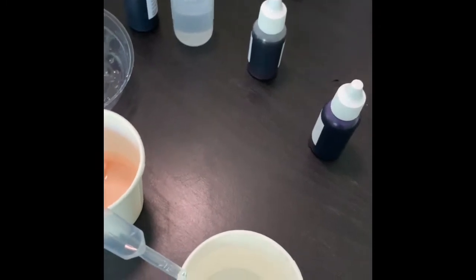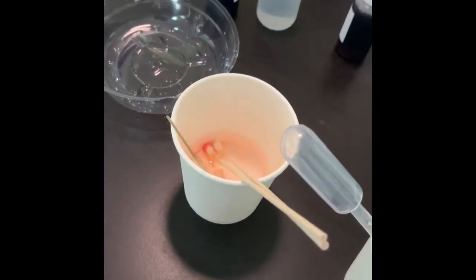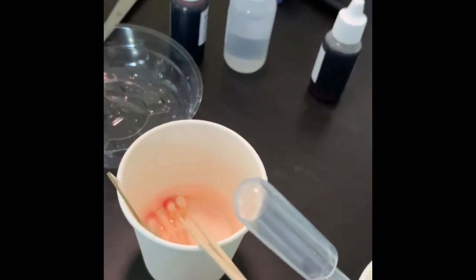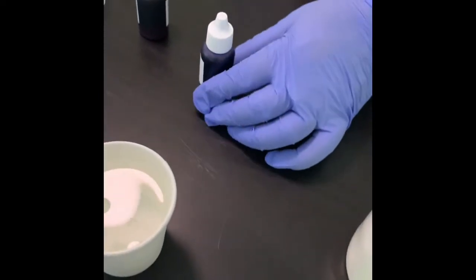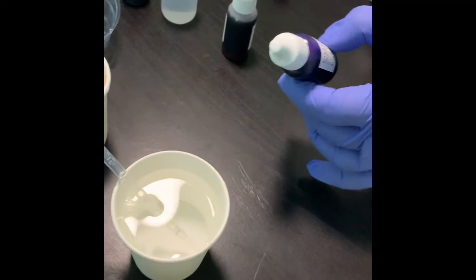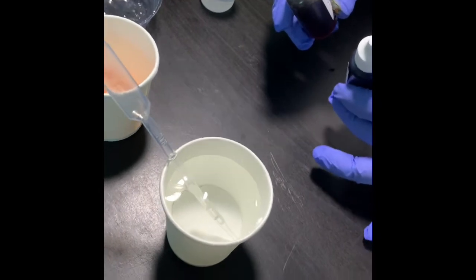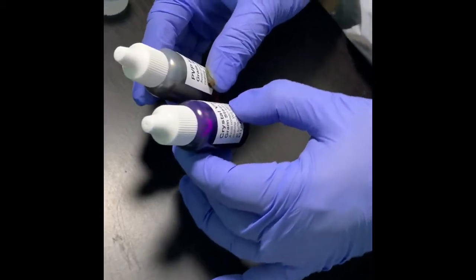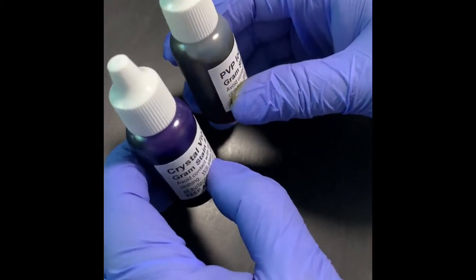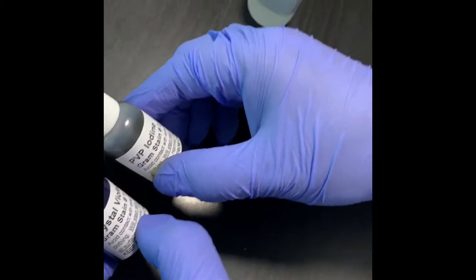So the principle of the differential stain, this gram stain, is that due to the thickness of the peptidoglycan layer, the gram-positive bacteria can actually retain the color of the primary stain. So our primary stain here, the crystal violet, is present. Then we have the gram's iodine, which will act as a mordant, kind of a glue that will make a complex with crystal violet and will fix that crystal violet stain in the cell wall peptidoglycan layer.